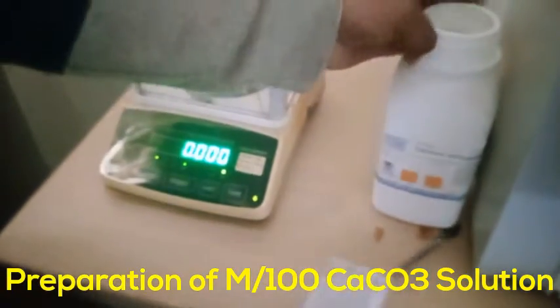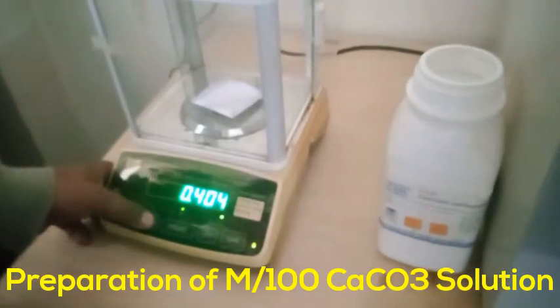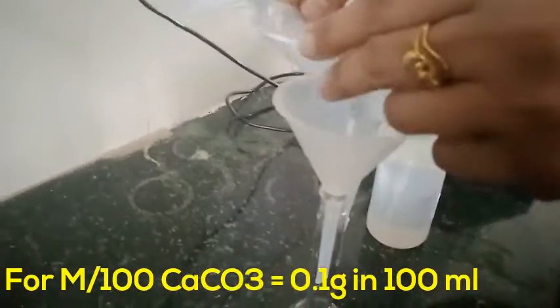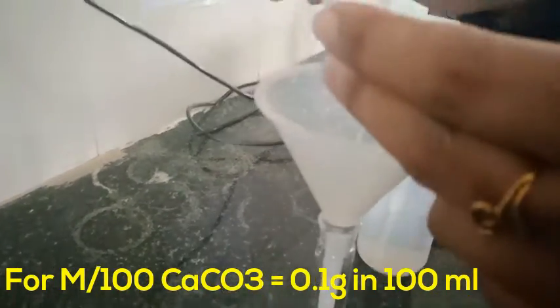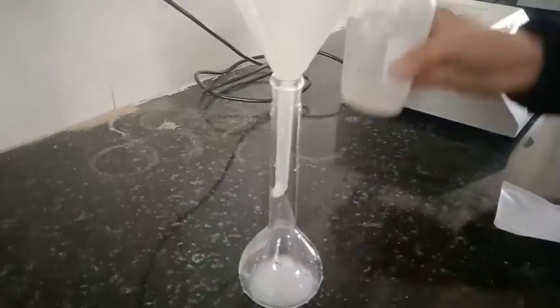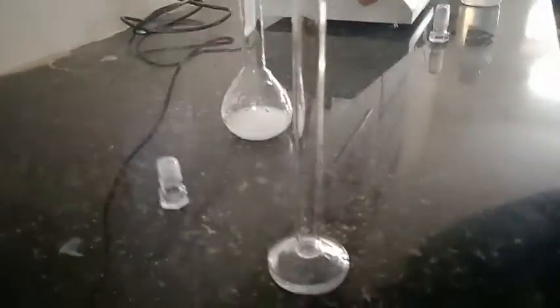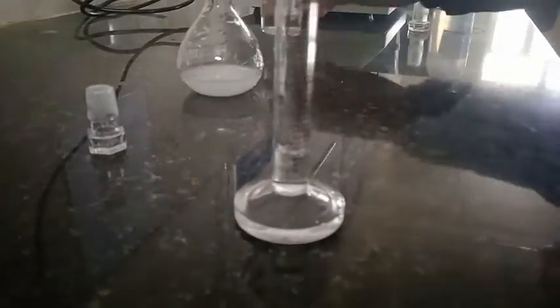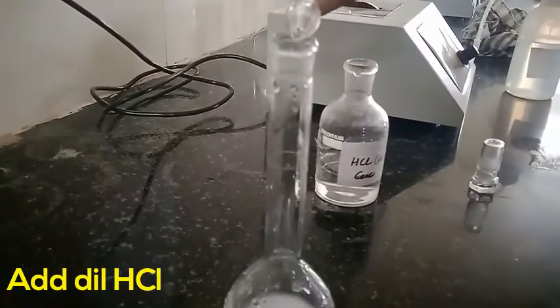Here I am going to show you how to prepare the M/100 calcium carbonate solution. I am taking the calcium carbonate — the calculated amount is 0.1 gram — and dissolving it in 100 mL. Since calcium carbonate is insoluble in water, I am going to add 1 mL of diluted HCl solution.